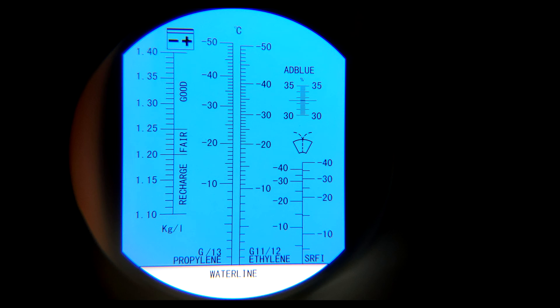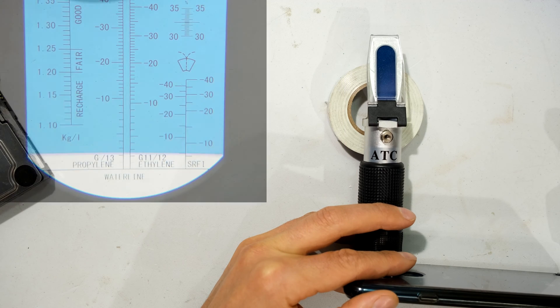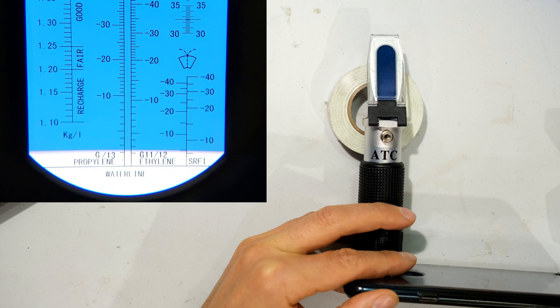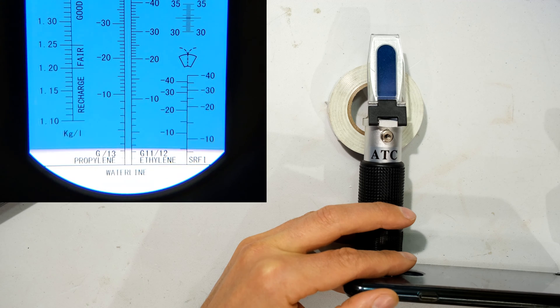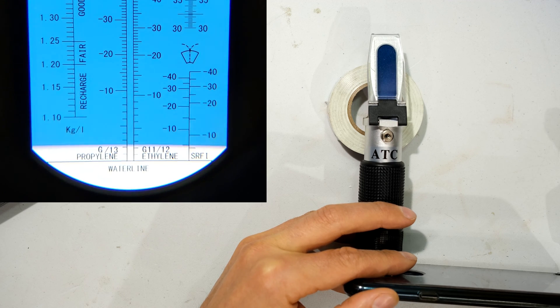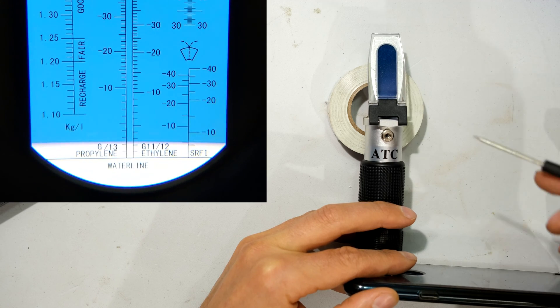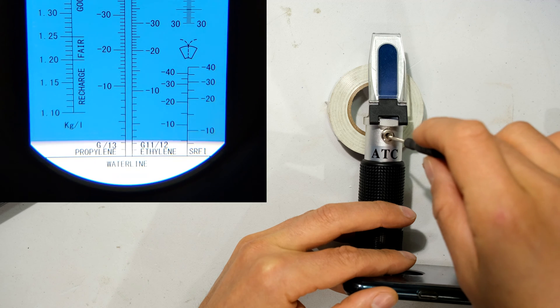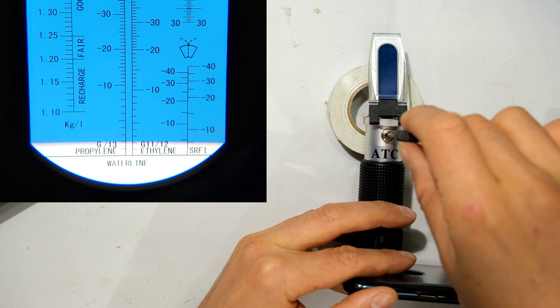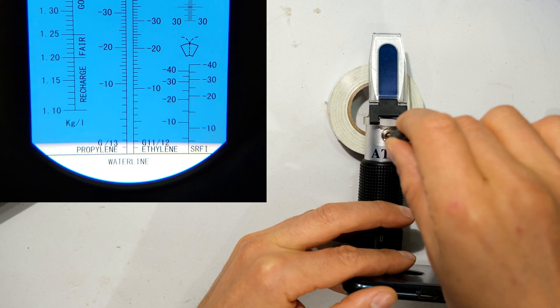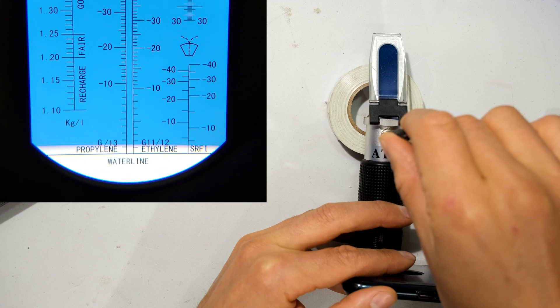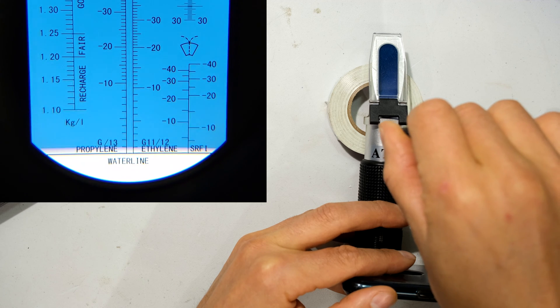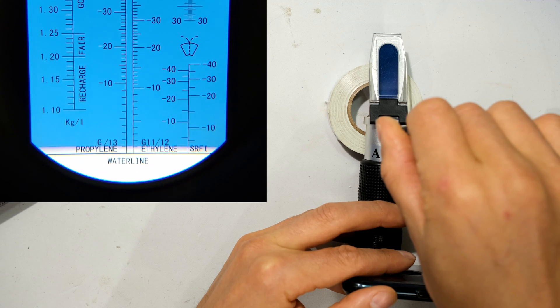If it wasn't, what you would need to do is adjust the screw. So for example, when you look through the viewfinder, you see this. You see the blue shading is above the water line. So what I'm going to do now is take my screwdriver, put it over there and turn it until that blue line, until the blue shading meets that water line.